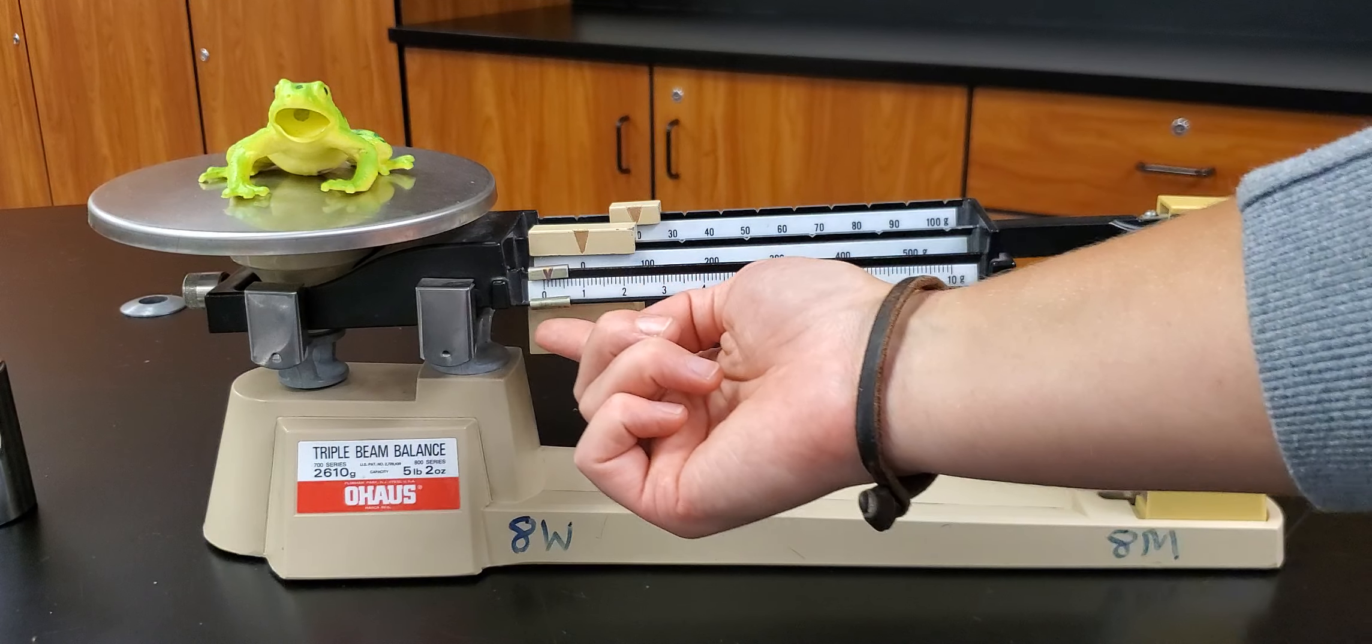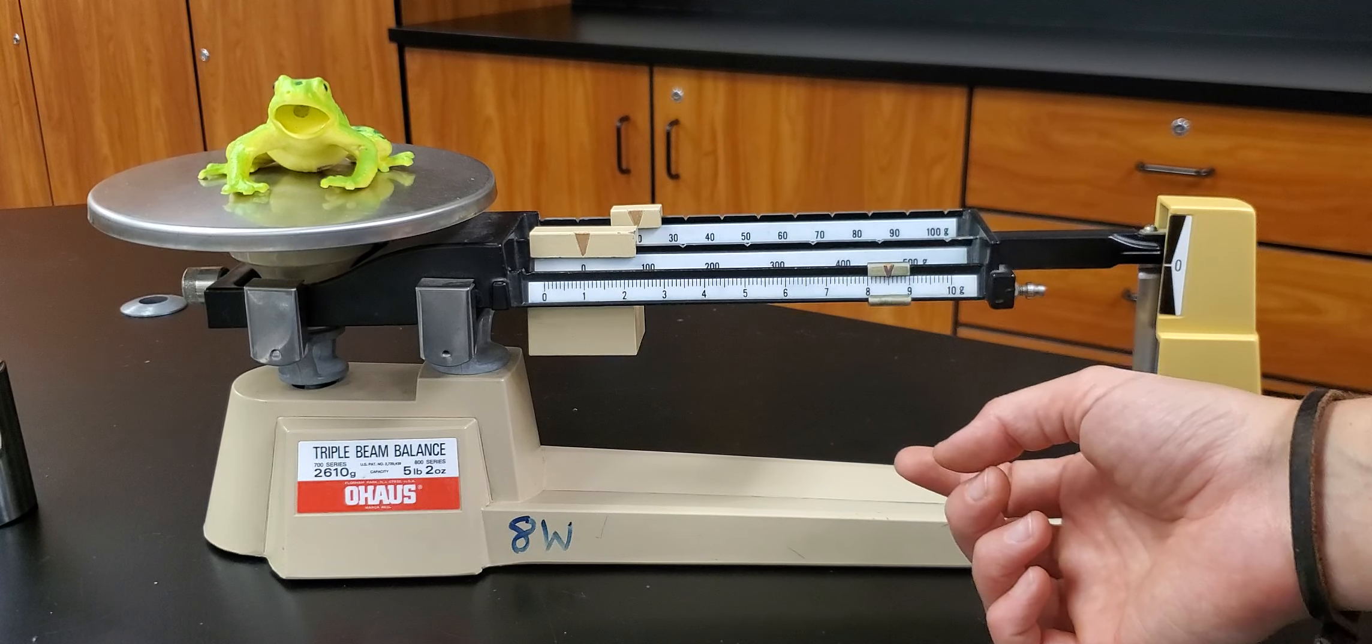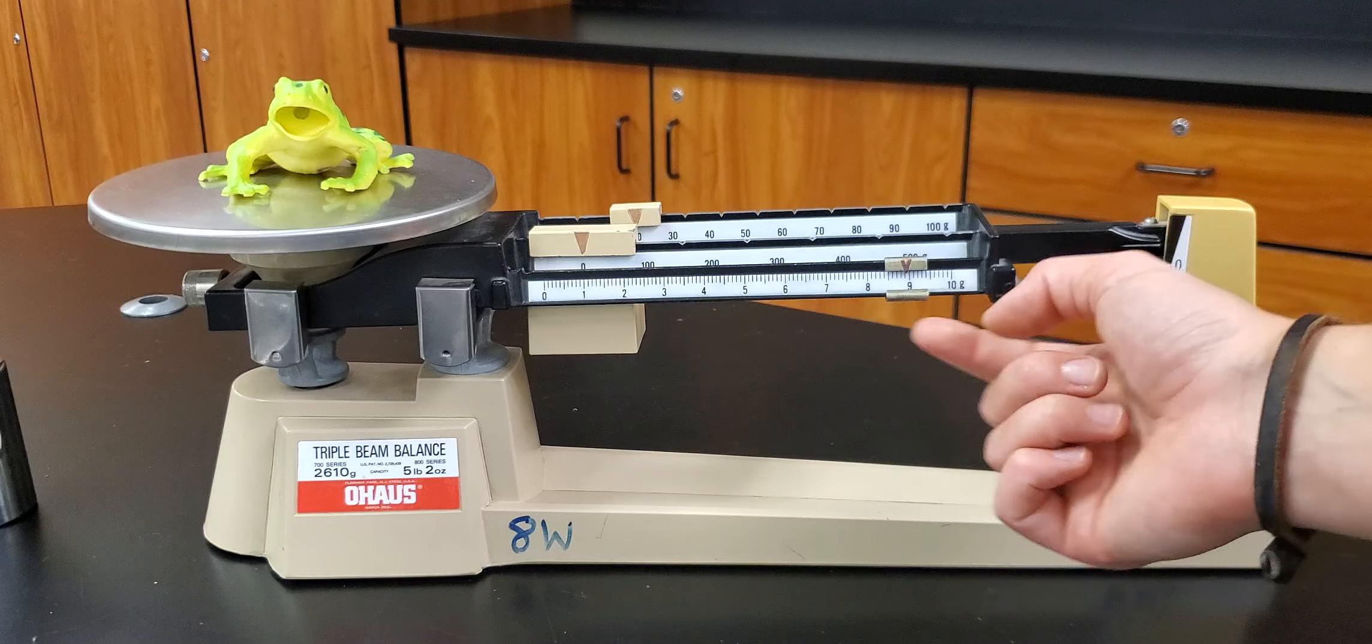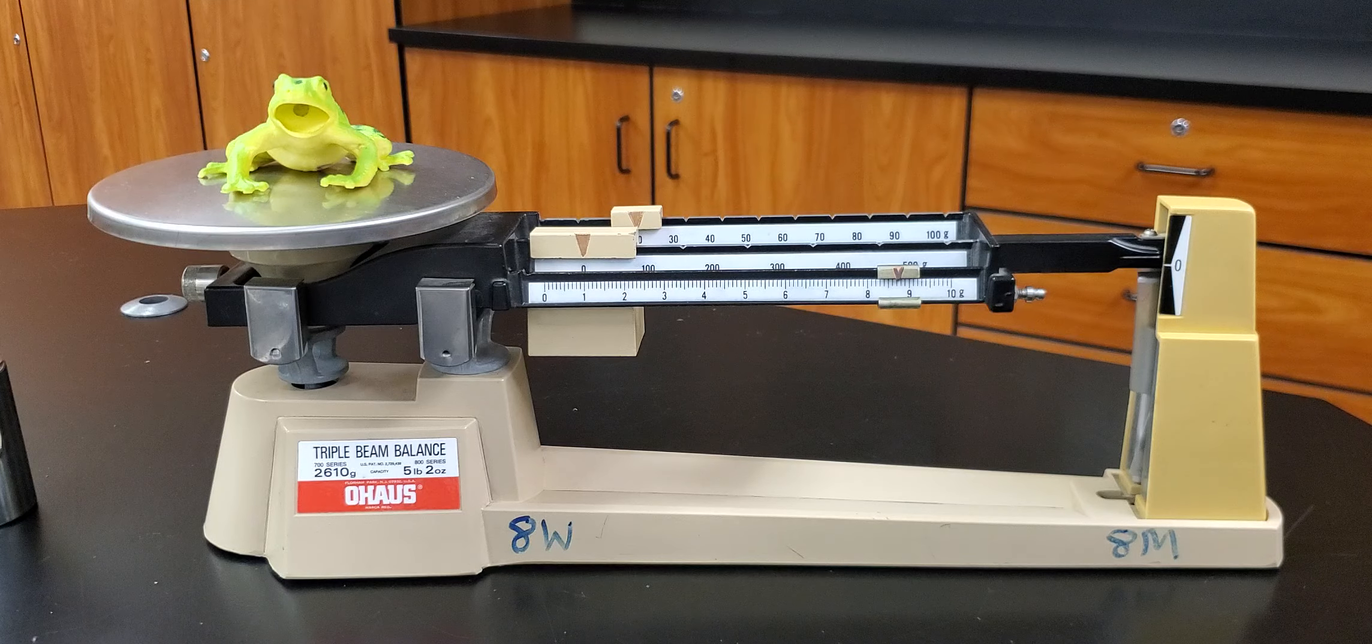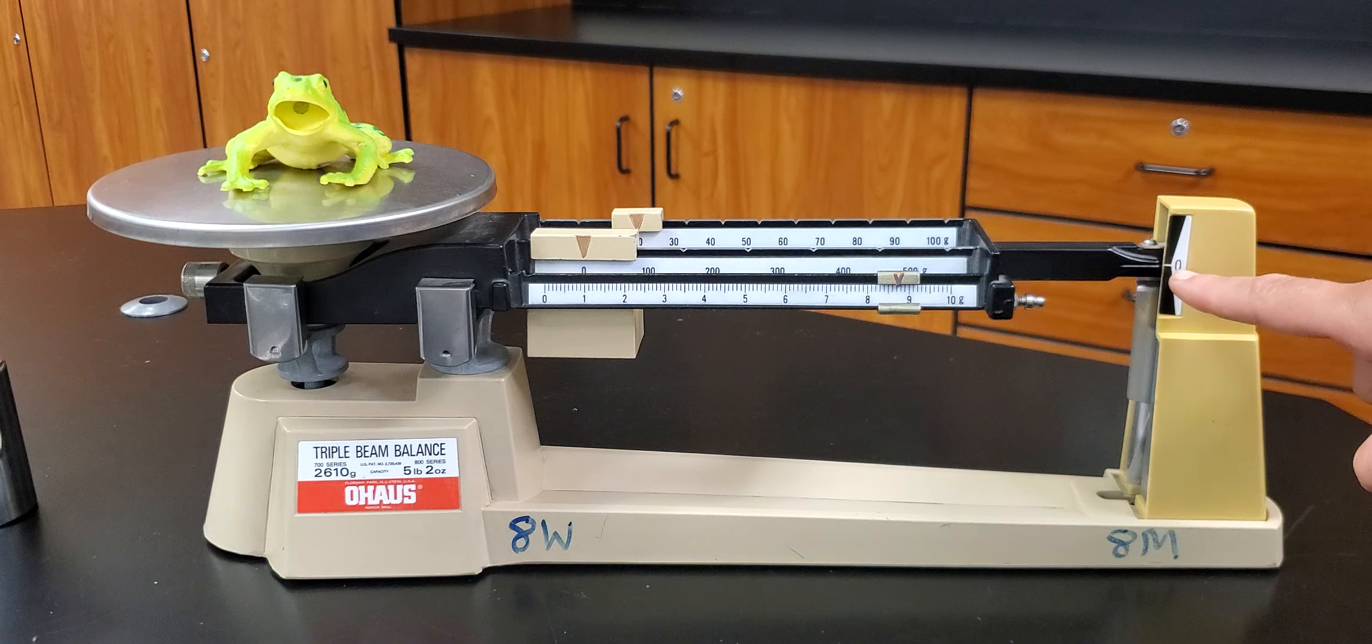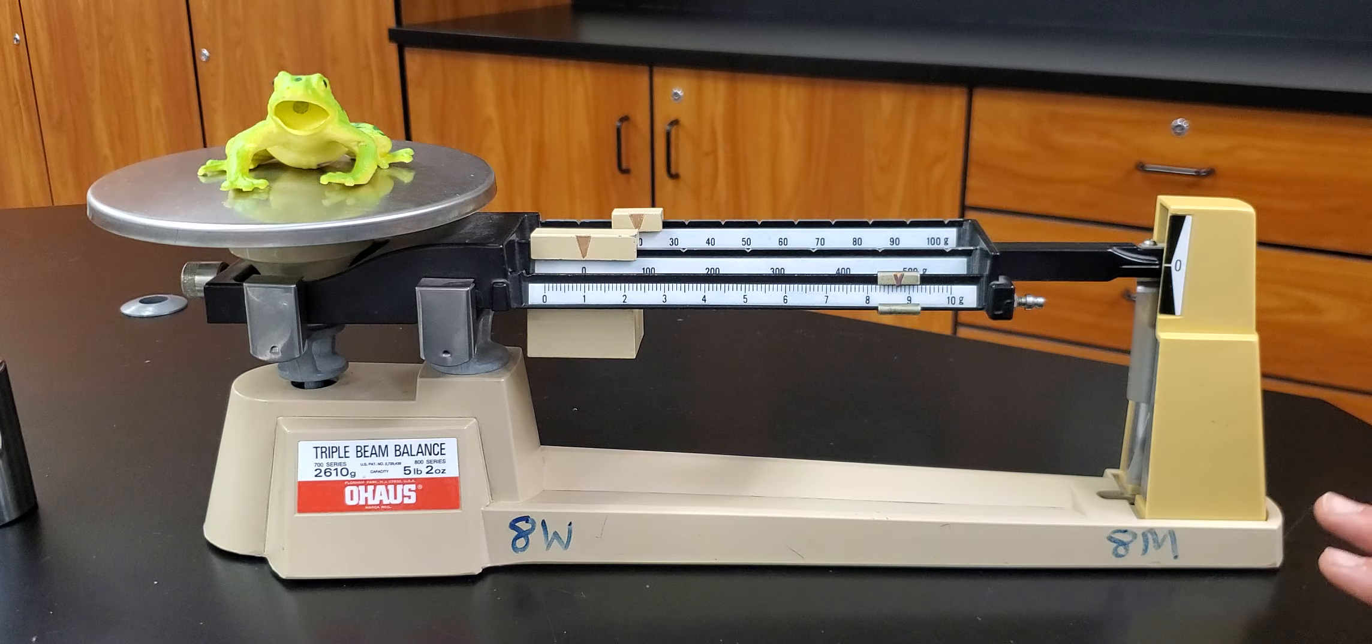Now finally I have this slider up here. There's no grooves on this one. This one I just slide along until the arm balances out. Looks like we're almost there. That's probably too much. Let's go about right there and see what it does. And I think that's pretty good. Sometimes you need to give it a little bit of time to balance out but I think that that is pretty good there. So now we've got everything balanced out.